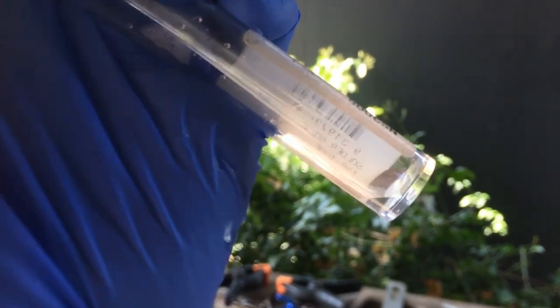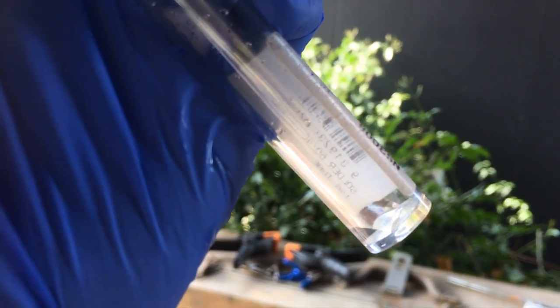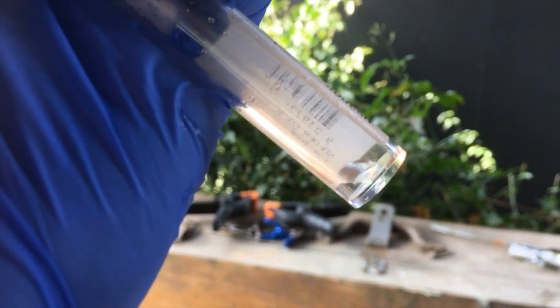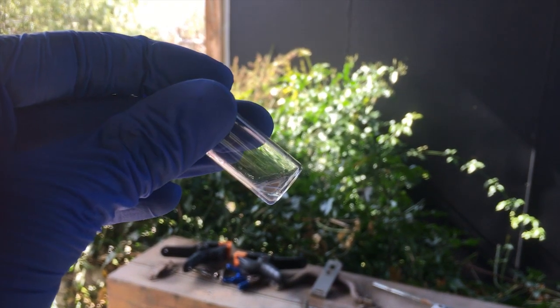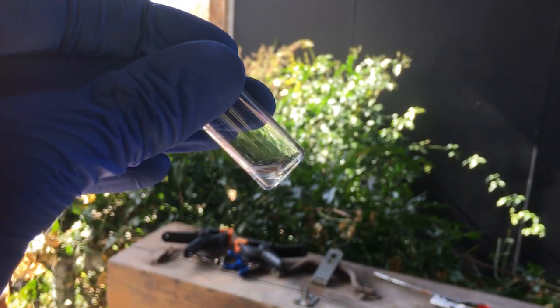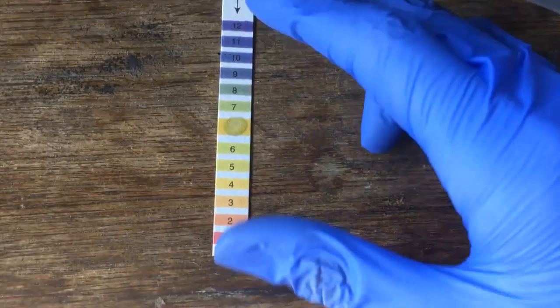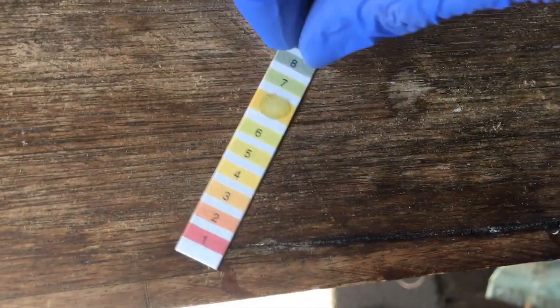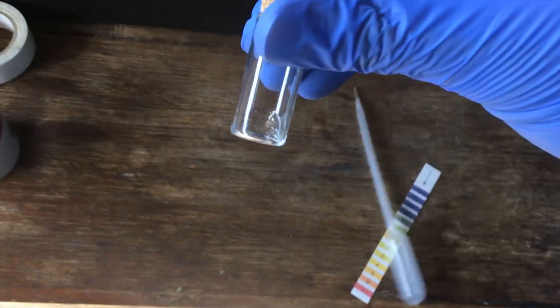And that's that. Hopefully I got all of it. So we'll extract that from this vial, put it in a smaller vial, and we will do some tests with it to see if it's pure enough and see if it is actually heavy water. Definitely hope I don't have to distill that again. Let's see if it is basic at all. And very good. Checking the pH shows us that we have a pH of about 7, which is excellent. We have pure water, which might be heavy.